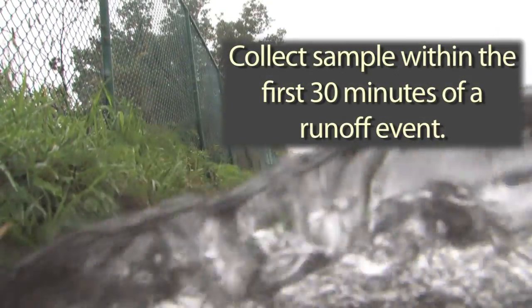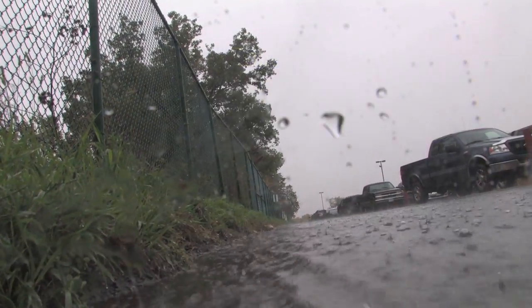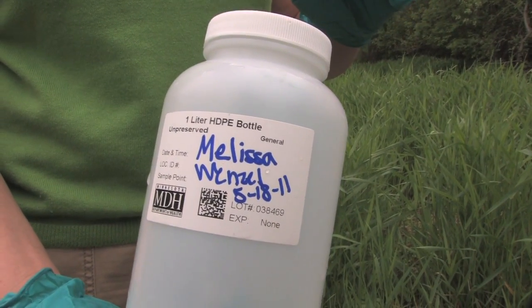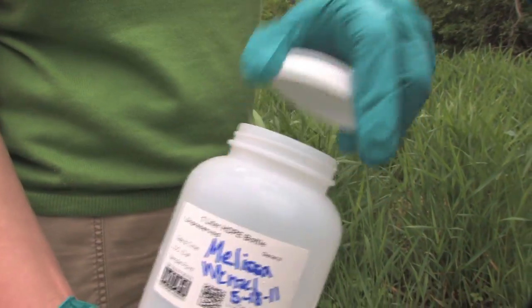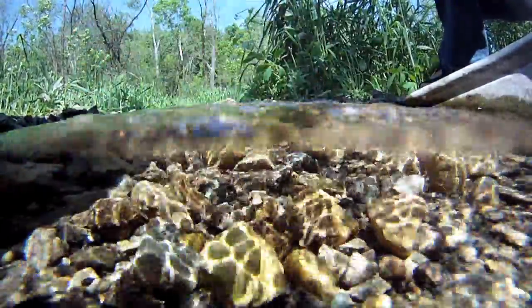Make sure that you choose a time and location where stormwater is flowing. Collect the sample within the first 30 minutes of a measurable runoff event. Before you go outside, be sure to write the name of the person collecting the sample and the date the sample was collected. While wearing gloves, remove the cap from a clean bottle. You do not want to contaminate the top of the bottle, and do not place the lid on the ground or in your pocket.